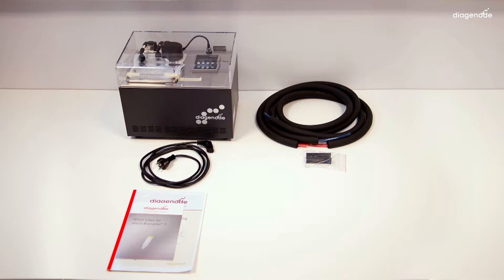There is also a plastic bag containing a cutting device if you need to shorten the tubings, but be careful to have enough slack. There is also a 24-volt cable to enable communication between the chiller and the sonicator. There is a little transparent tube for draining. And finally, you can find some Colson's necklaces if you want to secure attachments.